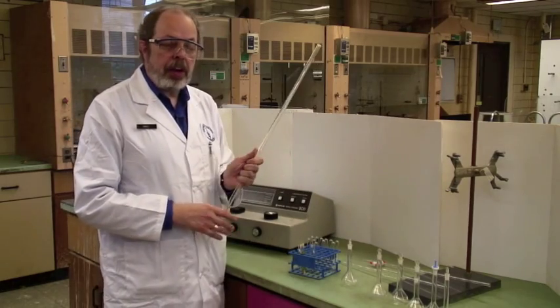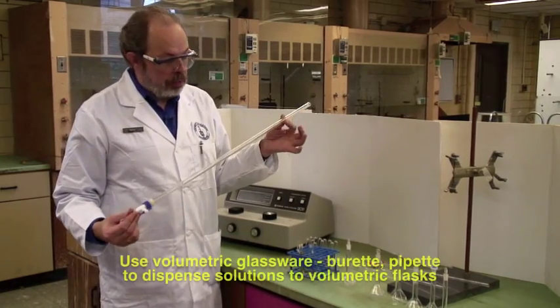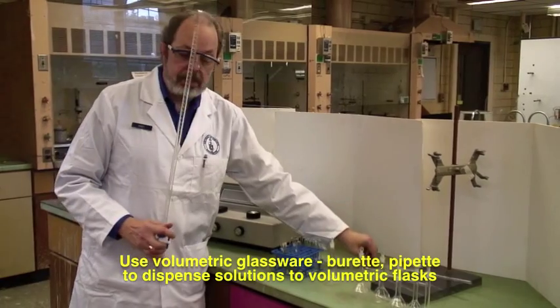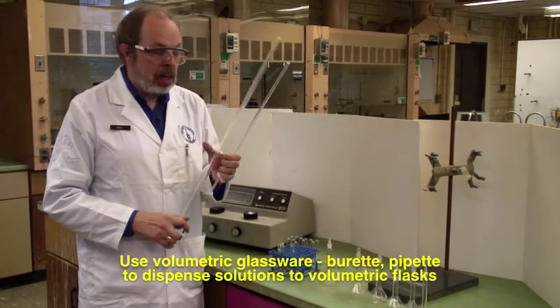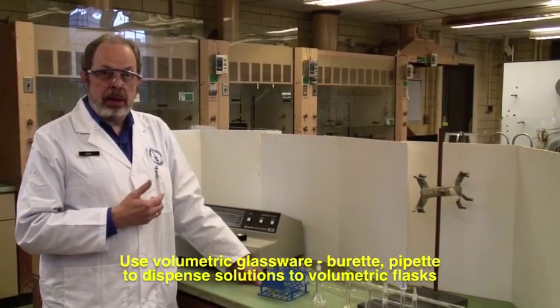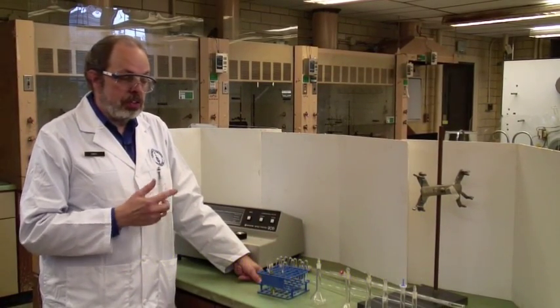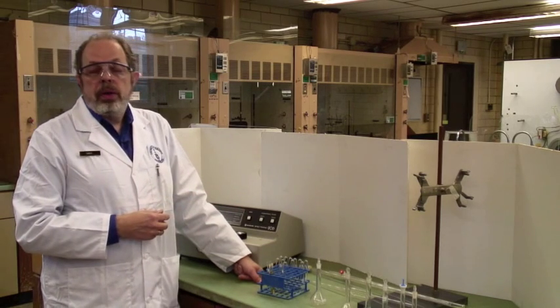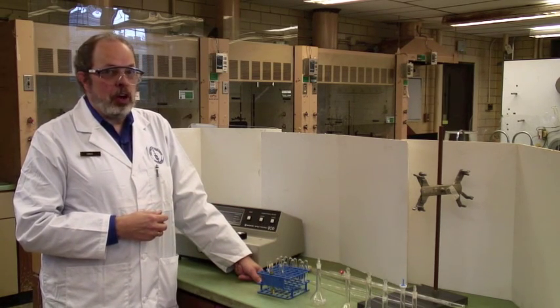You'll be dispensing different amounts of liquid. We've got burettes in various sizes. This is a 50, this is a 10. You can also use pipettes to make sure that you dispense the various amounts of the different solutions that you need into the 20 volumetric flasks.